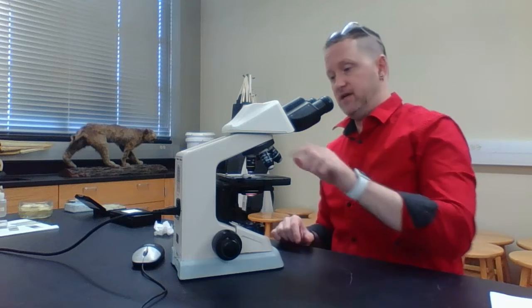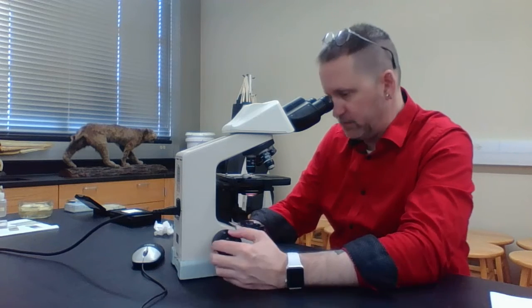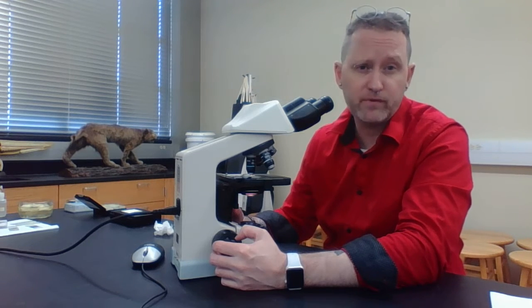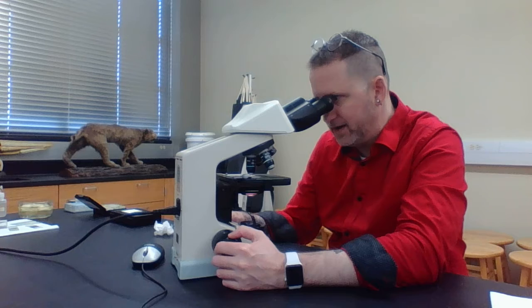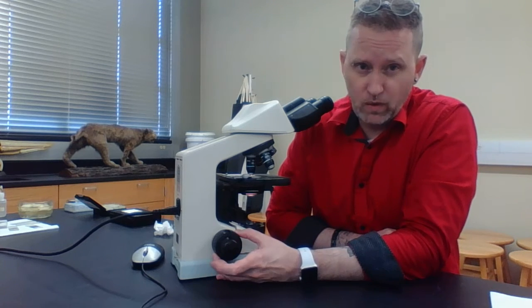Now what I'm going to do is go from your low power objective to the high power objective. Keep in mind, when you go to the high power, it's going to be hard to see all three threads because it's going to be magnified. I'm only seeing two threads right now. I can focus on one, more or less, but the other one that's underneath it is extremely out of focus. And again, I'm only using my fine focus, not my coarse focus.